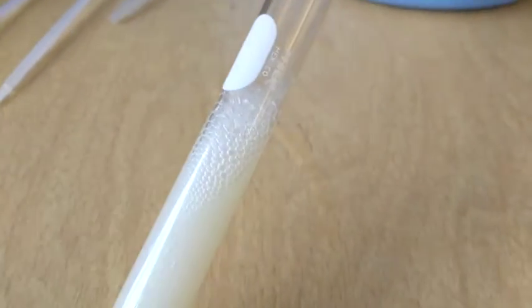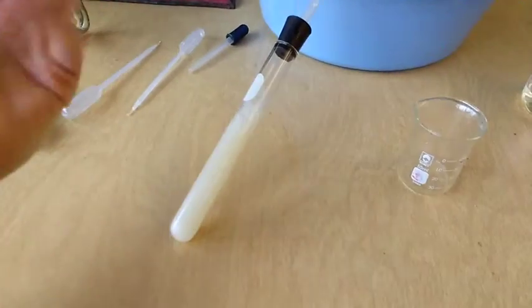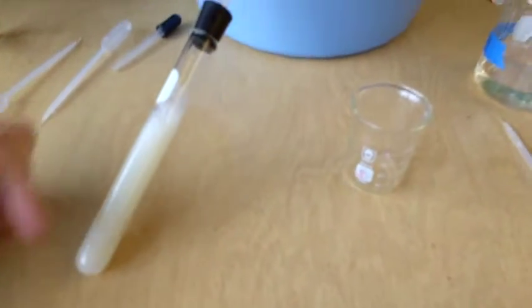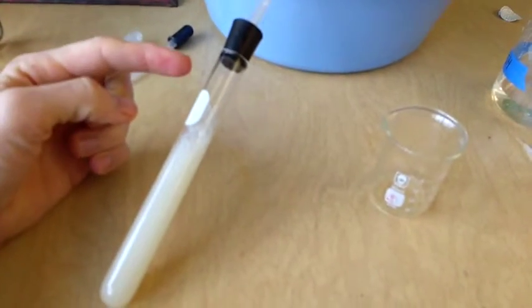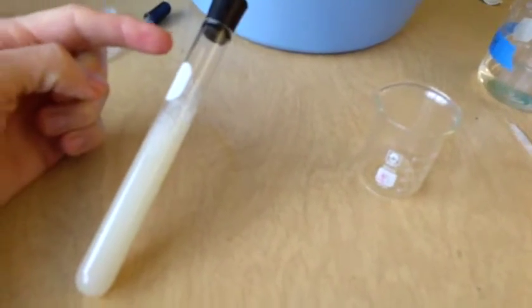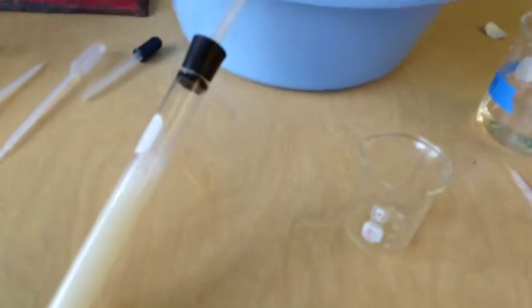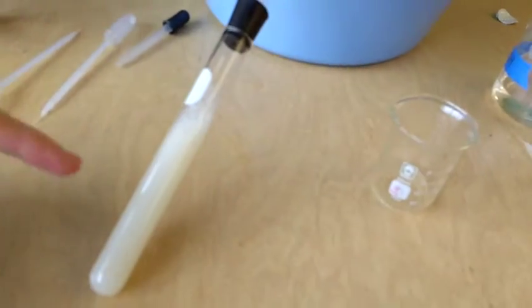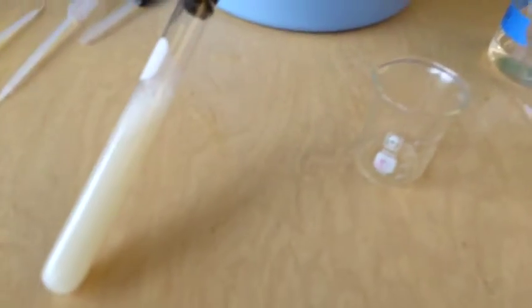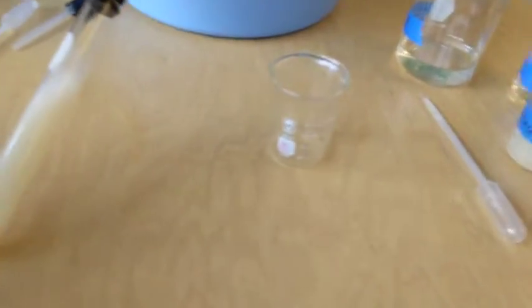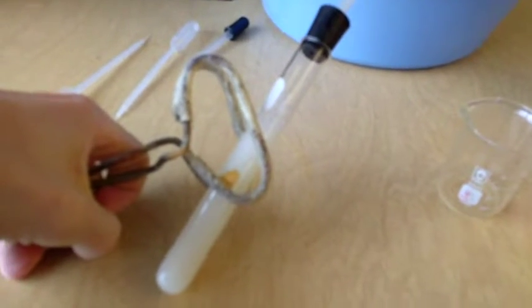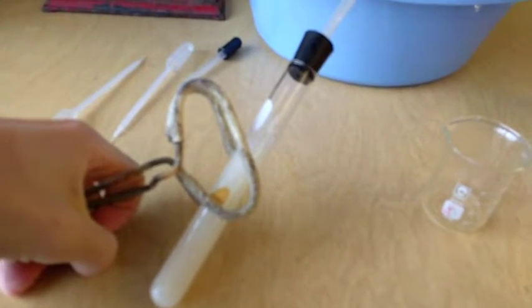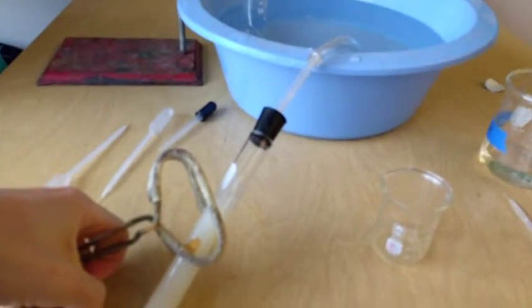Now one last important note is, if I were to grab this test tube with my hand, the warmth of my hand would change the temperature of the enzyme, and would change the temperature of the gas in here, causing it to expand. So you can either leave your test tube sitting like this, or you can use a clamp such as this. If you need to hold your test tube, hold it not with your hands, so the warmth from your hand doesn't affect the experiment.